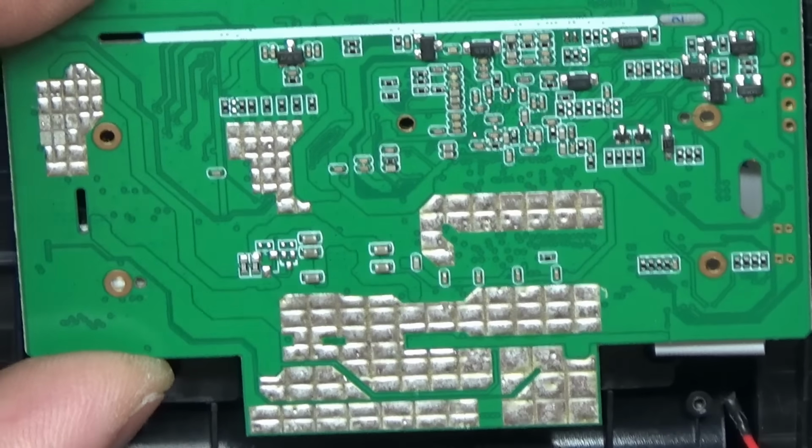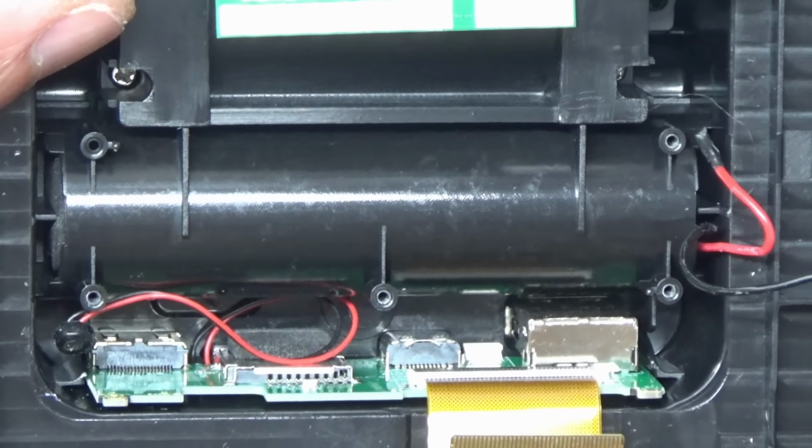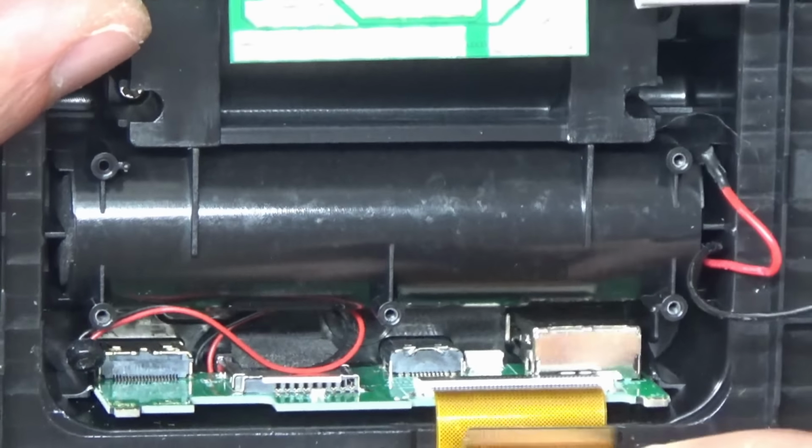Right, so this is the other board that we need to change, which is down here. And there's the microphone that I added, which didn't actually work. So let's get this board out.